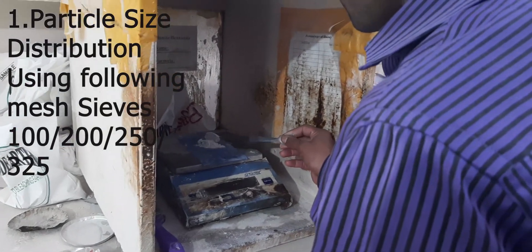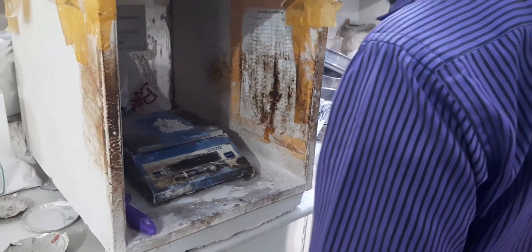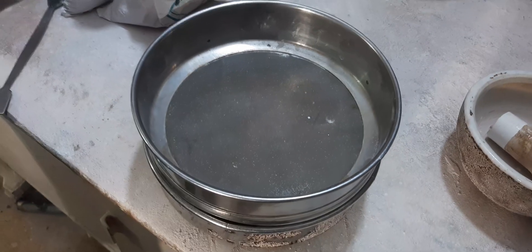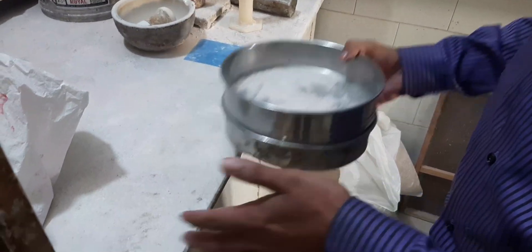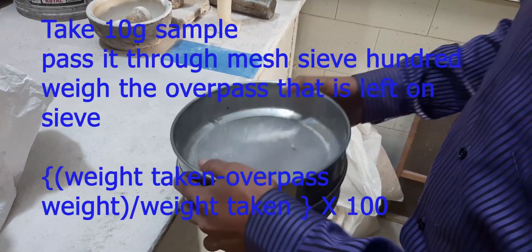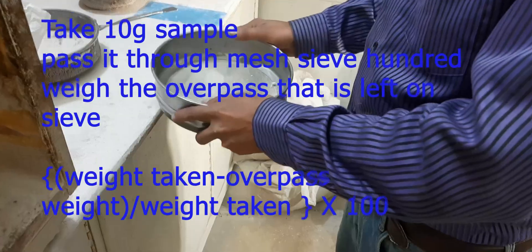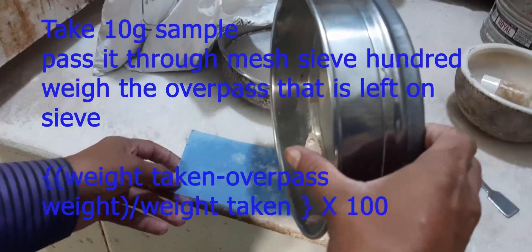We will take 10 grams of activated bleaching earth on a weight balance. The first step of particle size distribution is to pass it through 100 mesh. Now we will pass this powder through 100 mesh. After meshing it properly, we will weigh the remaining sample.